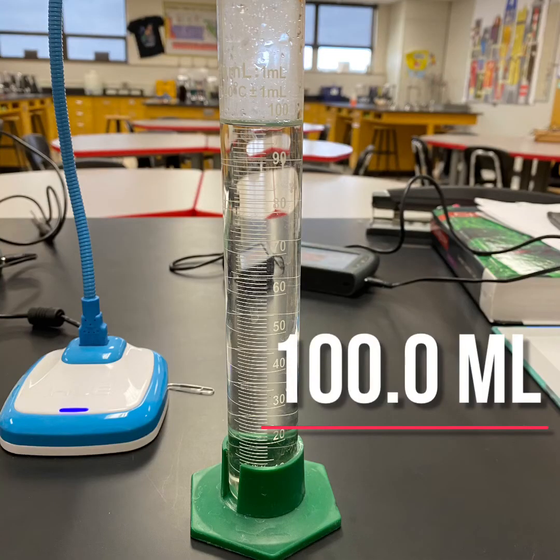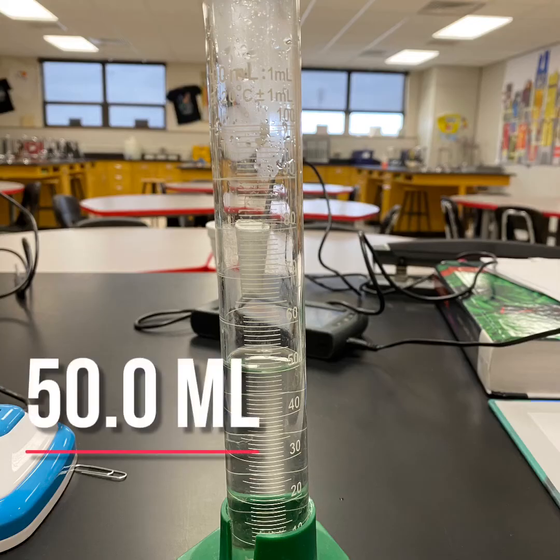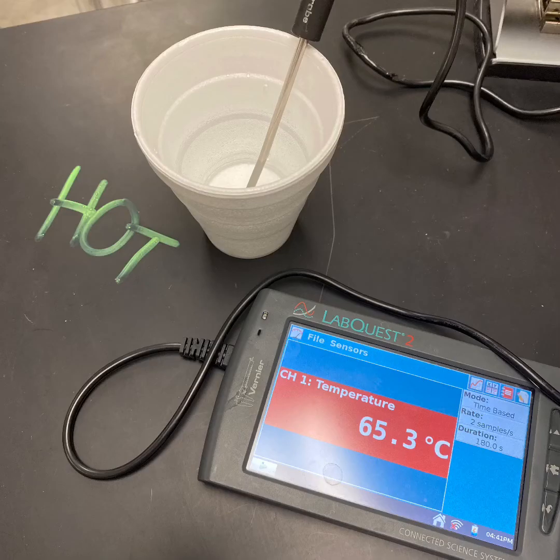First, I measured out 100 milliliters of hot water. Next, I measured out 50 milliliters of cold water. Immediately before mixing, I want to get the temperatures of both the hot and the cold water.